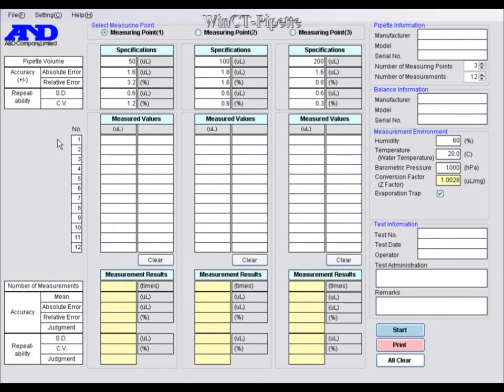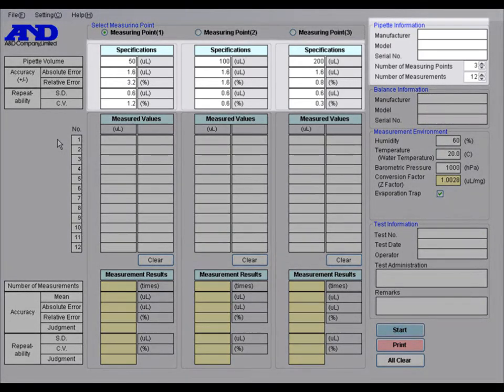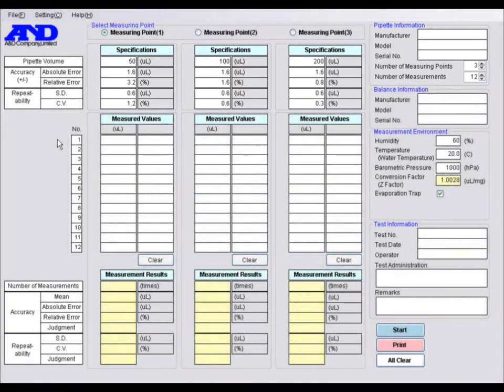This is the main window of WinCT Pipette, the special software that comes with the pipette accuracy tester. In these areas, you enter the pipette information and specifications.